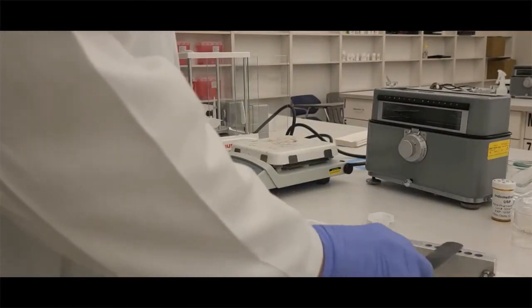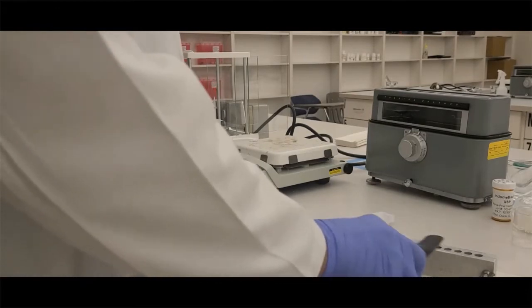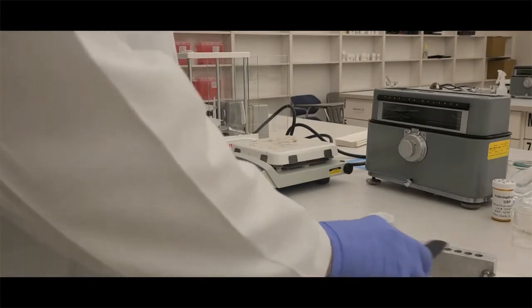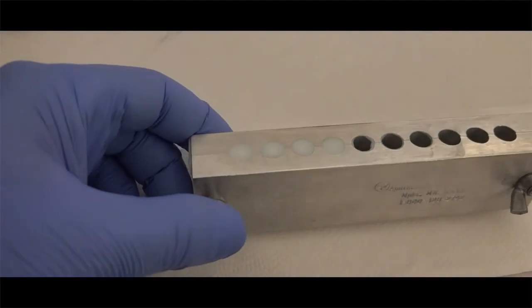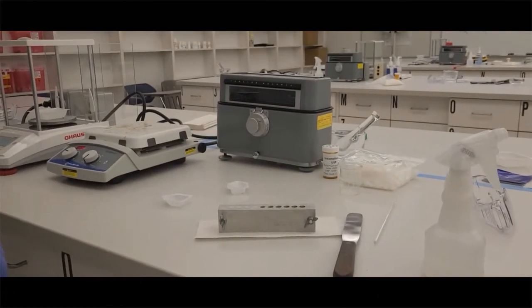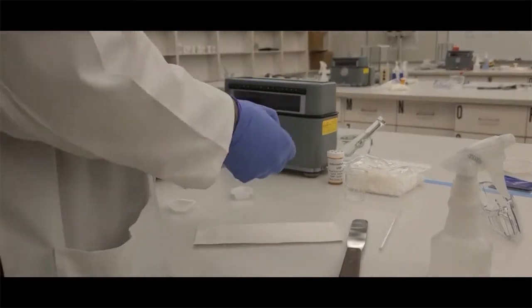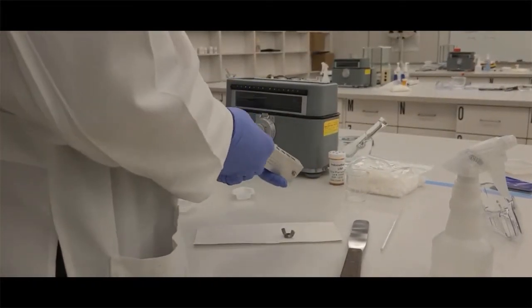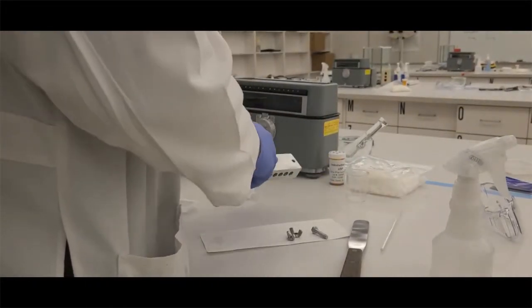I've got a hot spatula. I'm just rubbing it down the top, back and forth. I'm pushing that excess base off the top. I'm not scraping it, I'm melting it off. Now I have them nice and flat and flush. I'm going to allow those to cool.